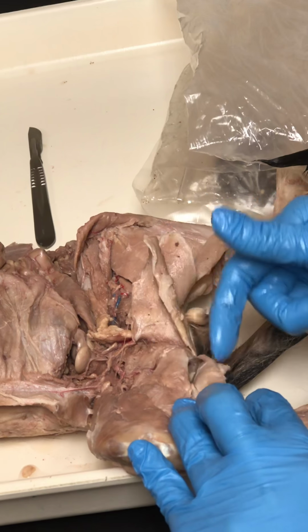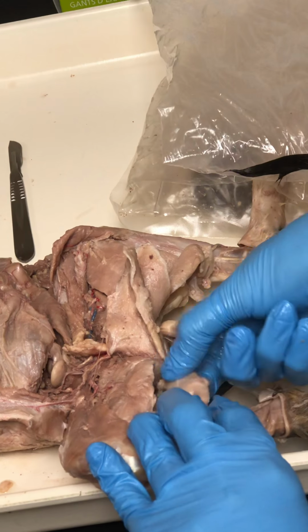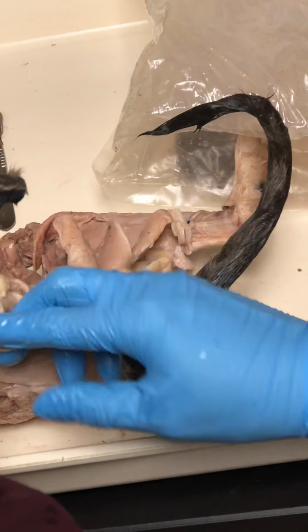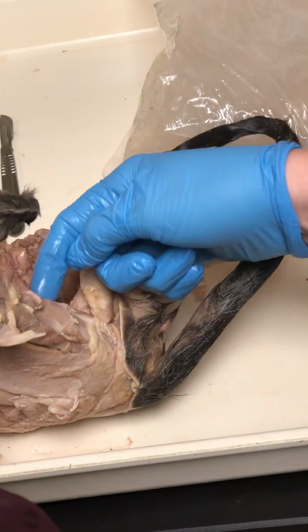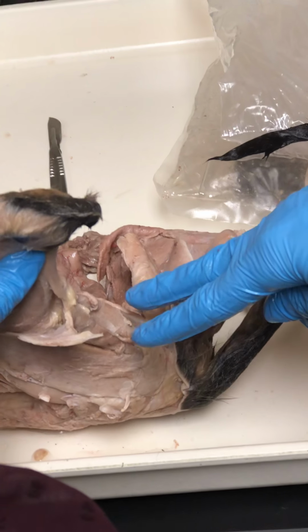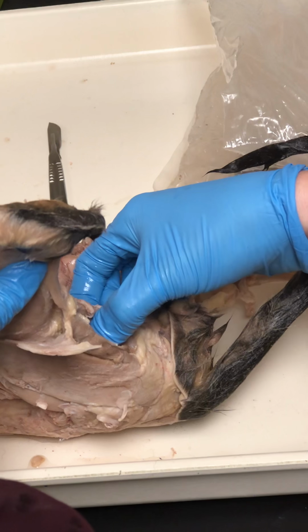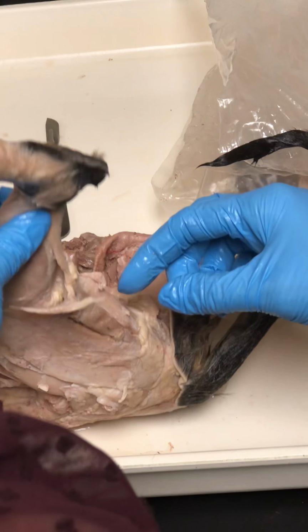So think membranosus and tendinosus. The tendinosus is like the skinny tendon-sized strip of muscle. The membranosus is much bigger. Again, like in us and our hamstrings, the semitendinosus is on the surface. The semimembranosus is just deep to that, because we look at our hamstrings this direction. Okay, and you'll see that on the models. Those two are actually in one piece of plastic on the model. It's actually one chunk. Okay?